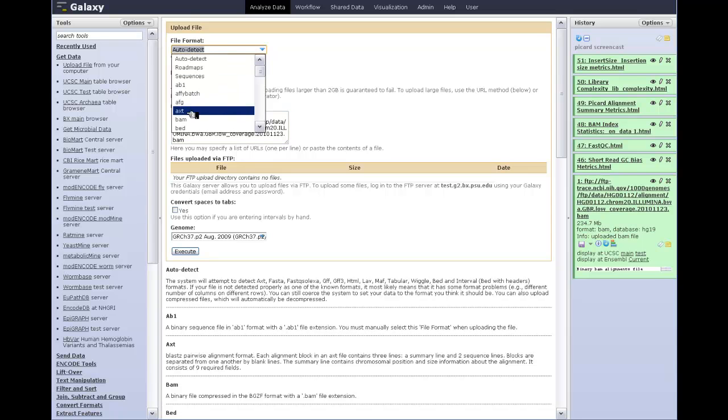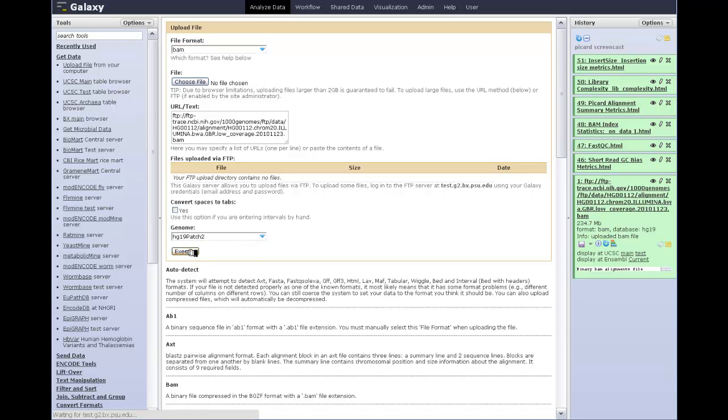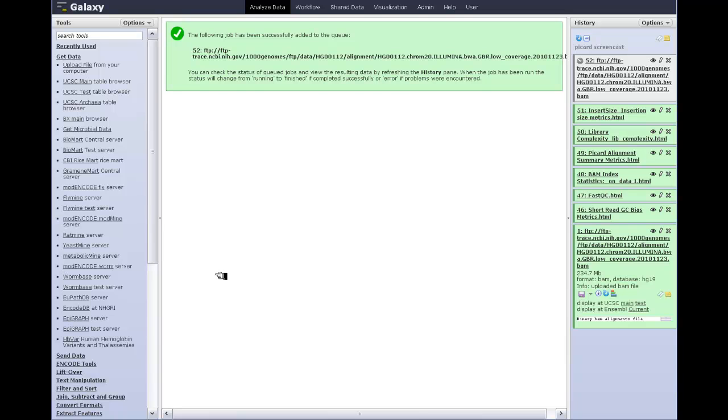I'll tell Galaxy this is a BAM file because I know it is, and I'll tell Galaxy that it's aligned to GRCh build 37 because it probably is. I click Execute, and Galaxy will now go away and get the data from the NCBI FTP site and put it in your history. When this job turns green, I'll have another copy of this data set.